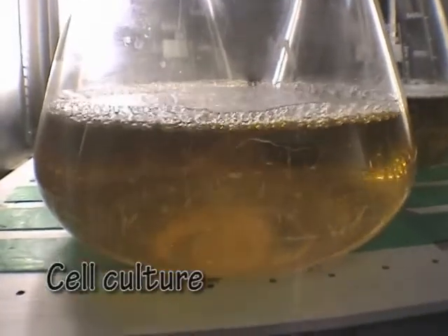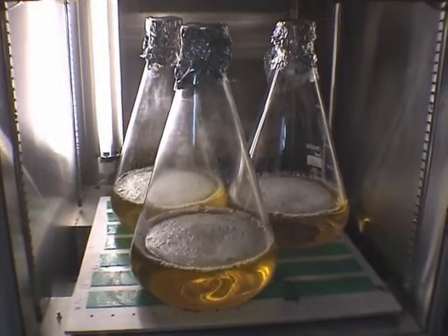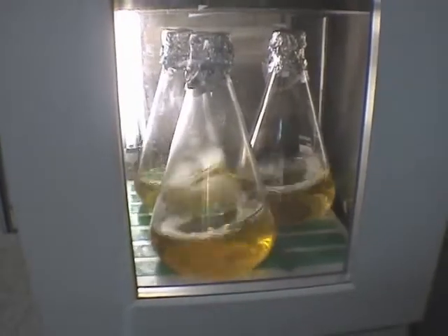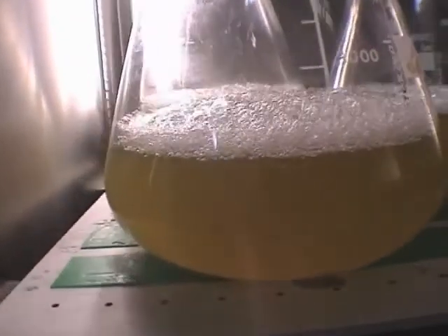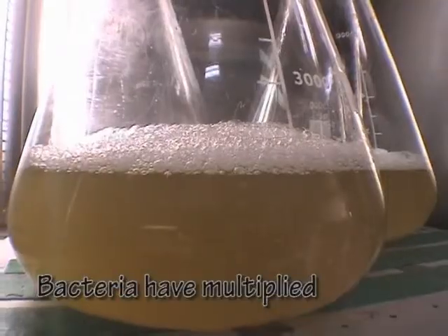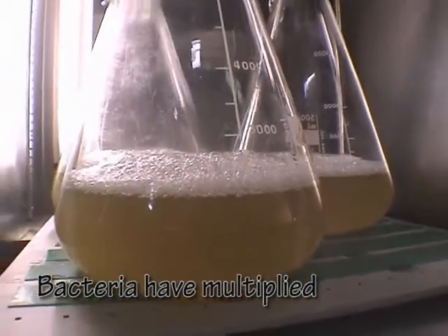A bacterial colony containing the correct gene is then grown as a culture. After one night of incubation at 37 degrees centigrade with constant shaking, the cloudy appearance of the culture confirms that the cells are multiplied.